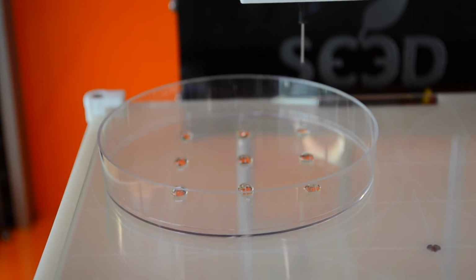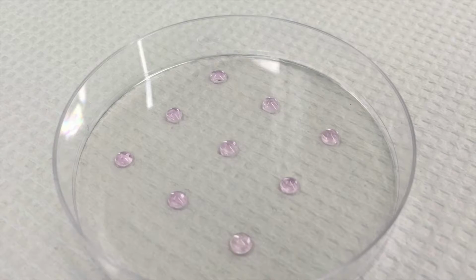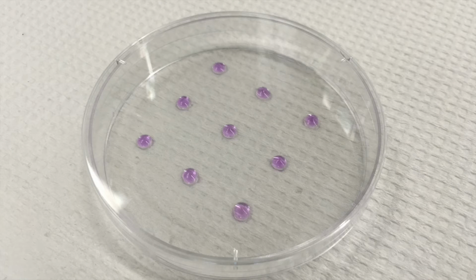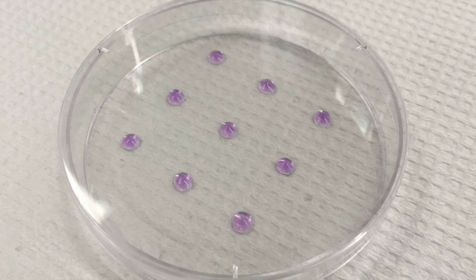Our prints are completed. Now we're going to wait for 4 hours to see a change in color. As you can see, it's now about 4 hours since we printed the array, and the color has changed from yellow to purple.